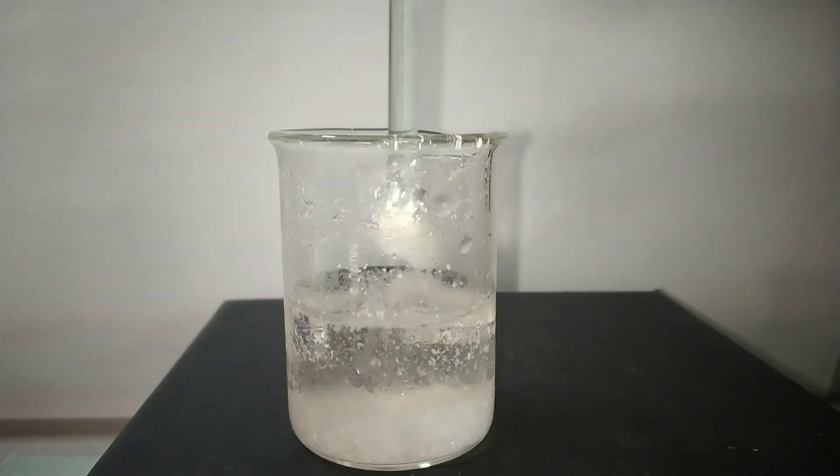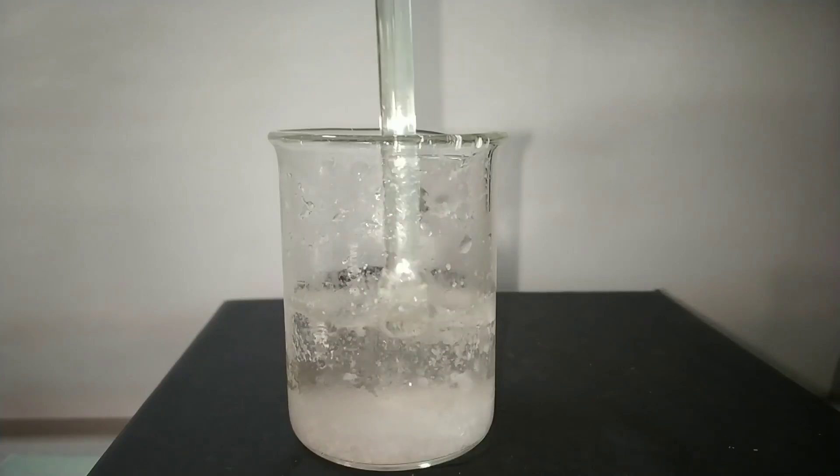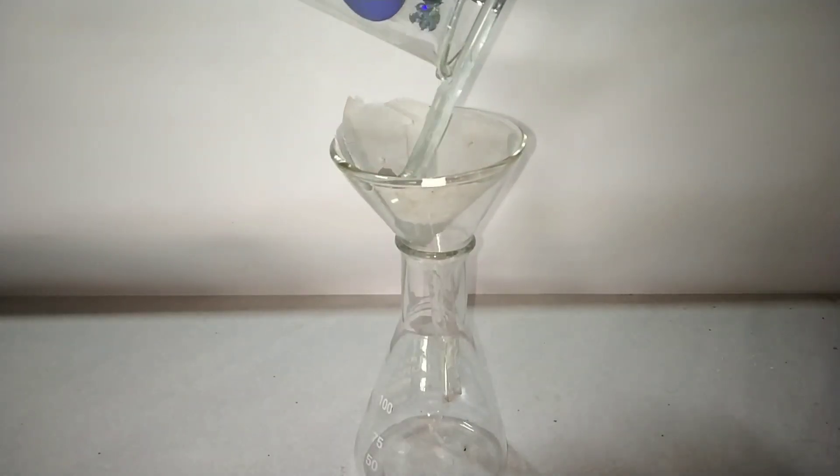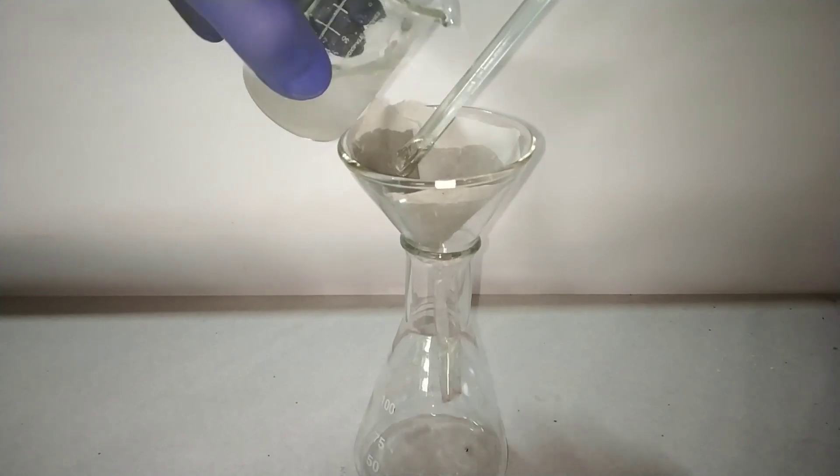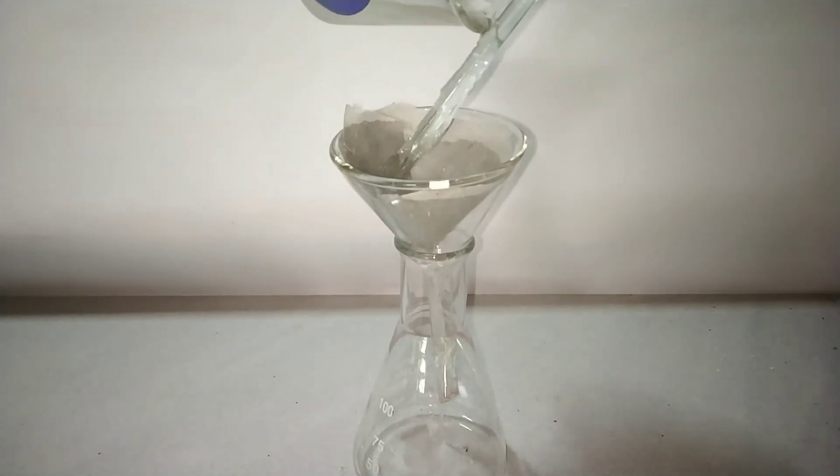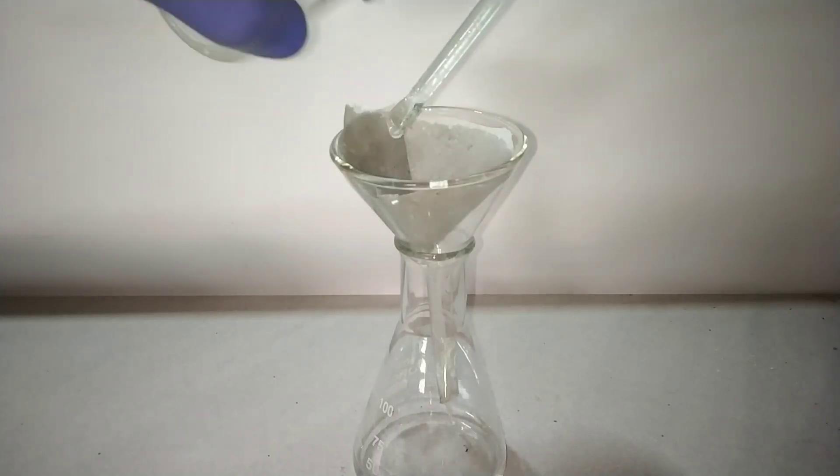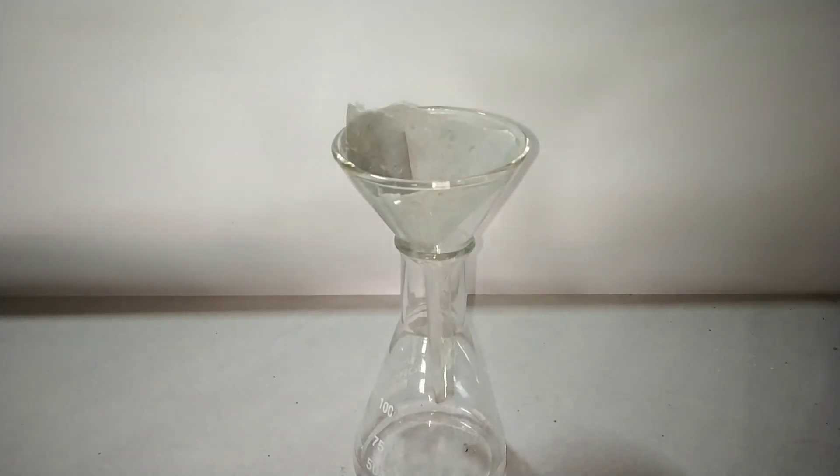Now I will filter the solution and collect the crystals. I have recorded a clip on the crystallization of acetanilide with the help of the time lapse mode in my camera. That video clip will be the next one to come in this video. I also took some of these crystals for looking under the microscope and I have captured some images of the crystalline structure of acetanilide. I have also included that in the next clip.